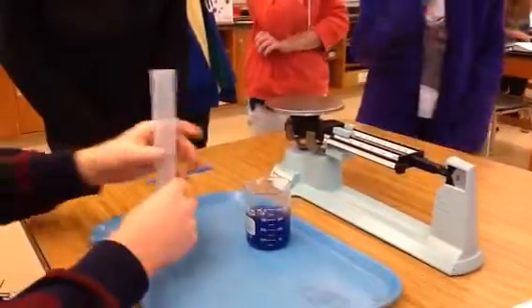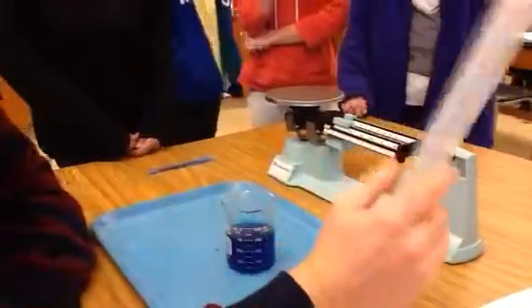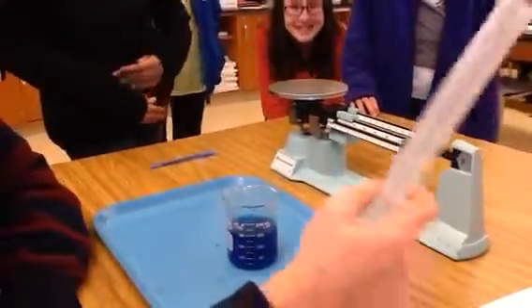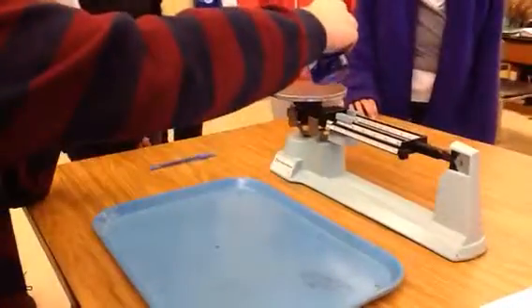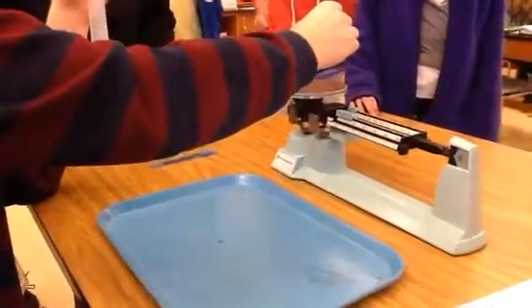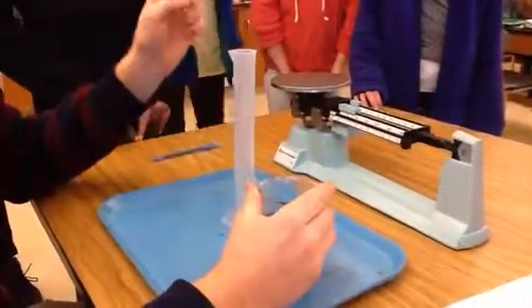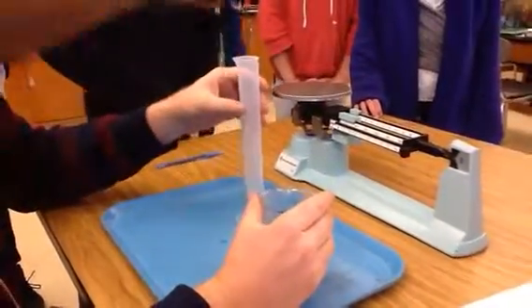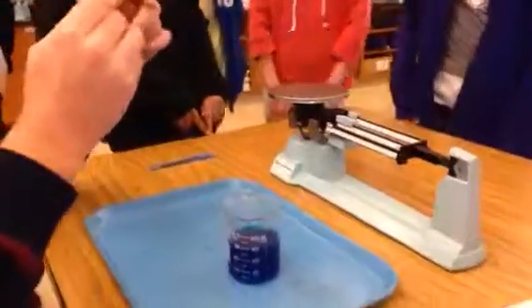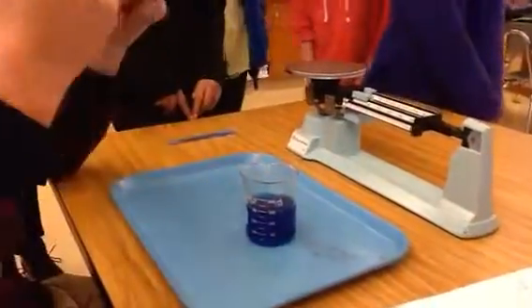So what do I do first though? I already have 25 milliliters. That's going to be my amount, right? But when I'm doing the mass of water, I can't just pour 25 milliliters onto the scale, even though my wife would laugh because I spill a lot. If I pour it on the scale, it's not going to sit on the pan, is it? So what do I have to do? You got to pour it in the cylinder. But there's one problem. If I pour it in here, it's going to give me the mass of the cylinder and the water. So what do I have to do first?